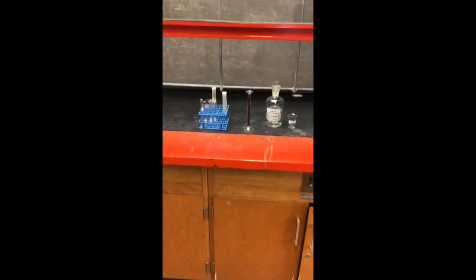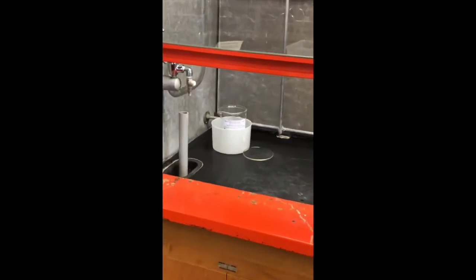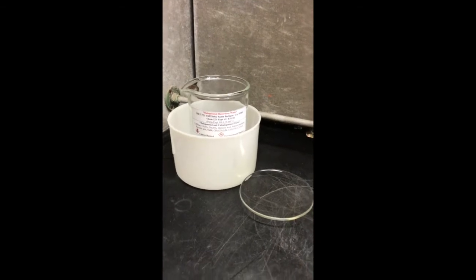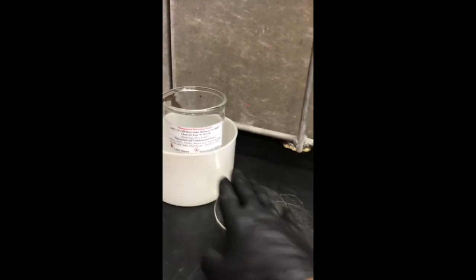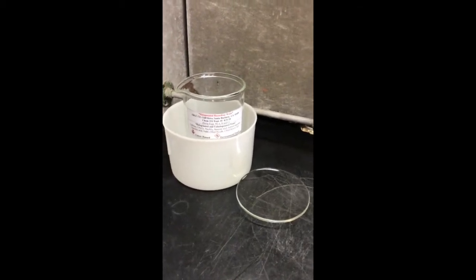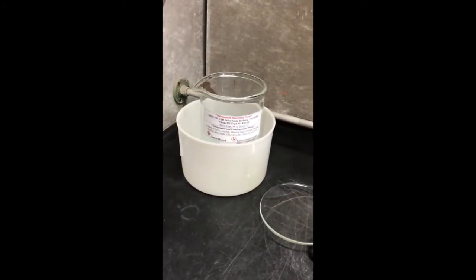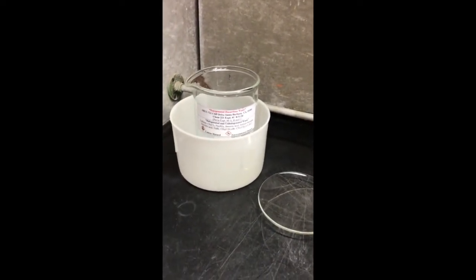You want to make sure whenever you're working in the hood, it's always on. And then I just put this one in here just to show you guys. We've got a waste jar here. So this is what our waste is going to look like. It's going to be likely a beaker inside of a secondary containment. So another container in case anything happens, like that glass breaks, the liquid that might be inside of here gets captured inside of this secondary containment, and we don't have a huge hazardous mess.